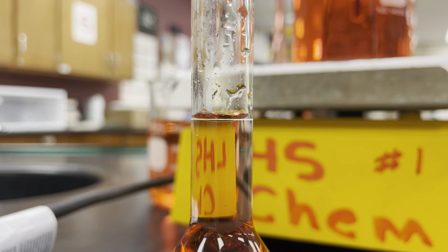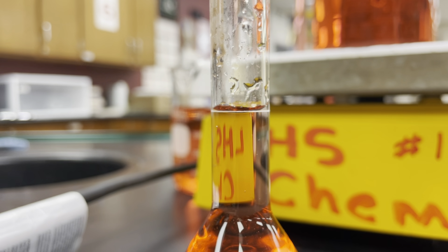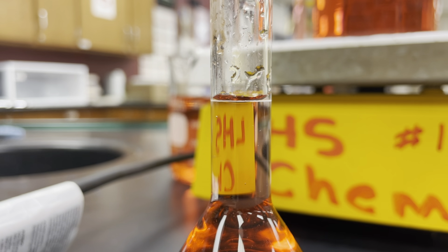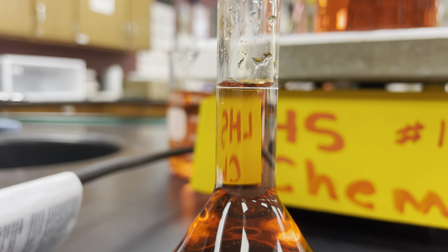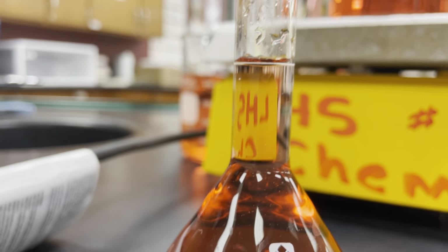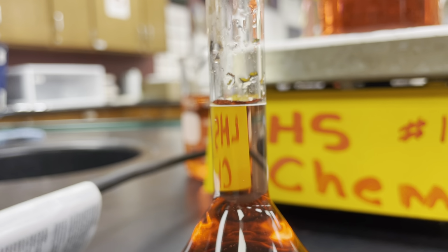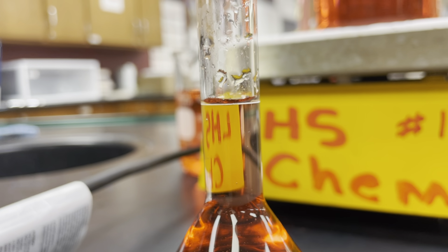Okay, so some glassware is a little bit more specific, and you might have to go digging and research a little bit to figure out where your uncertain digit goes out to. Same for volumetric pipettes, they should go out to 2 decimal places. So if you have a 25 milliliter volumetric pipette, you should be able to say that at the line you have exactly 25.00 milliliters. Now, I'm not saying that goes for every single volumetric flask and volumetric pipette. You should always research and double check somewhere, but that's a pretty good rule of thumb, that it goes out 2 digits at the decimal point.